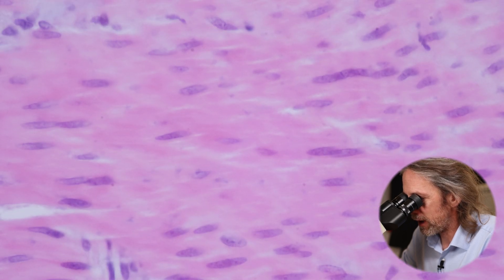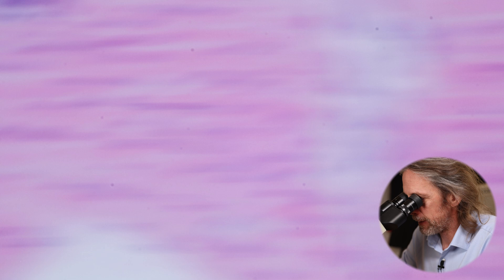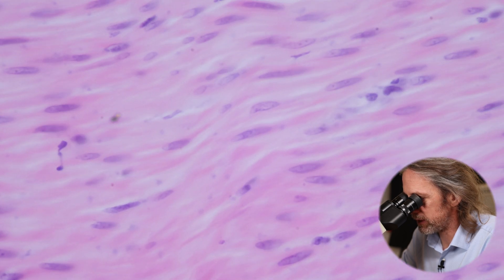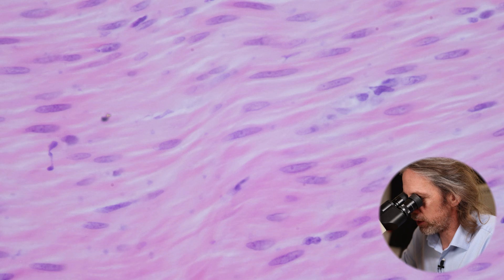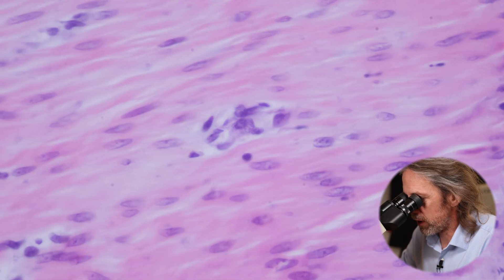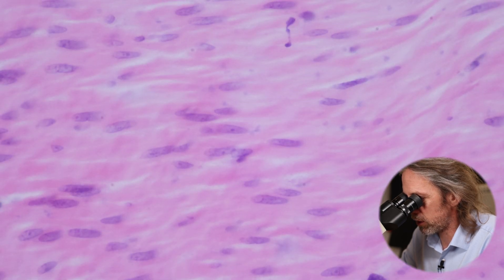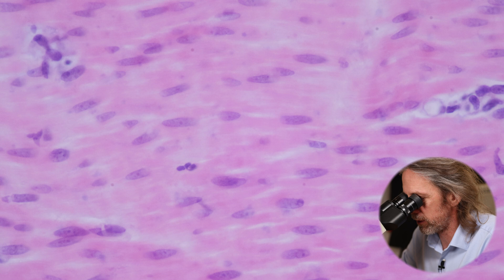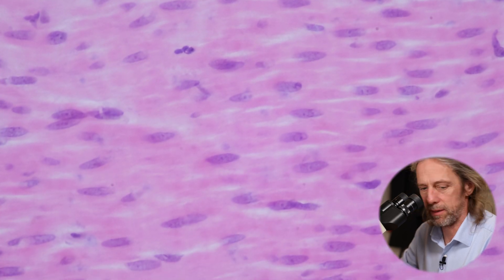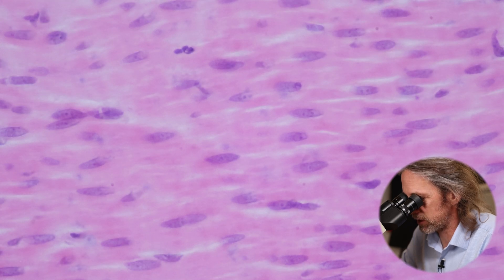These cells are often 20 to maybe 200 microns in length - they get longer in some areas of the body, like the uterus. We're starting to see a little bit of individuality here - you can see those very long cigar-shaped nuclei, and we can even see the nucleolus in the middle of them. Smooth muscle cells don't look quite as interesting as striated muscle, but they have their own characteristics.